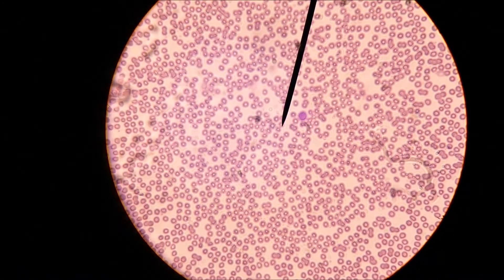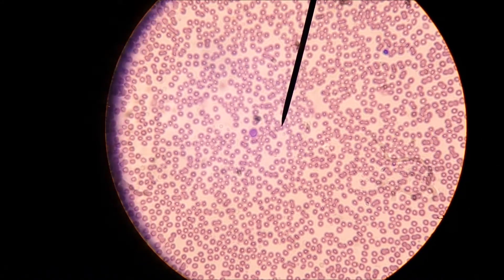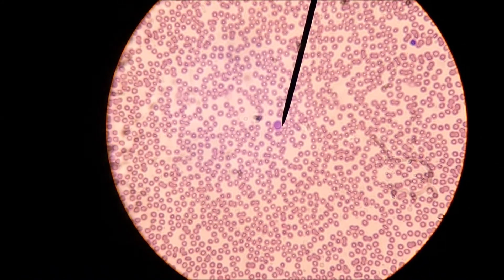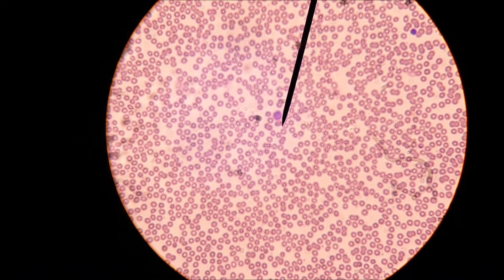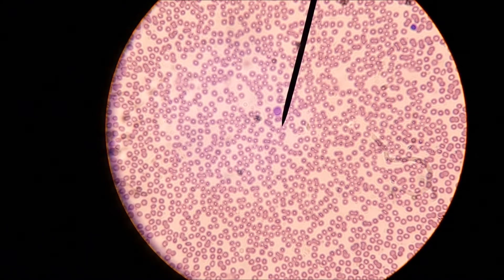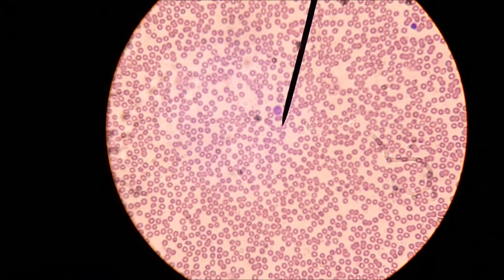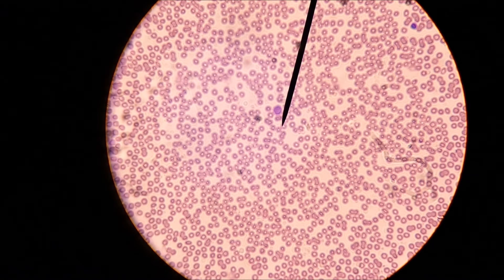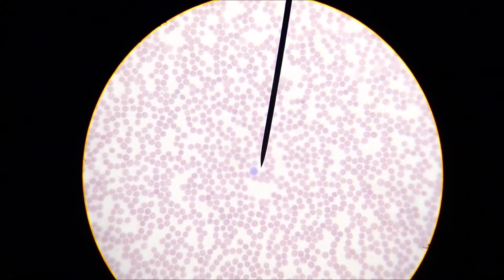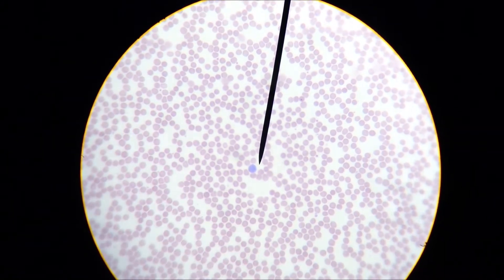There's a nice white blood cell, there's another nice white blood cell. I had high hopes of being able to go through and find all the different types for you, but now that I see what I'm dealing with in terms of looking through this scope, it's a little more complicated.